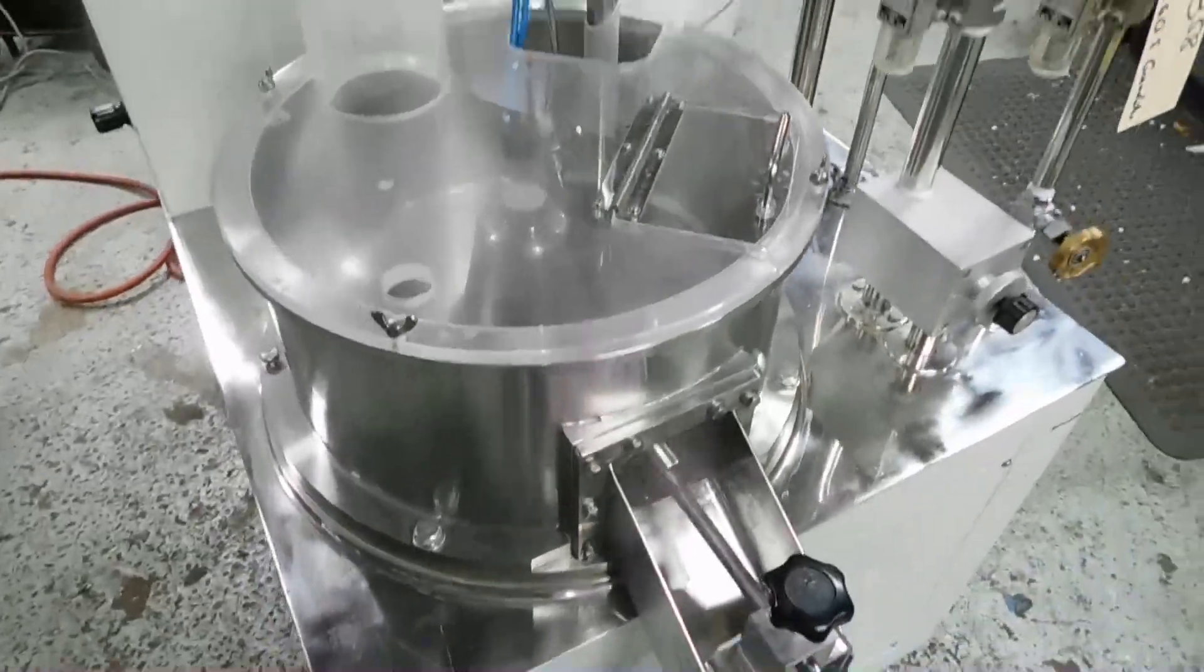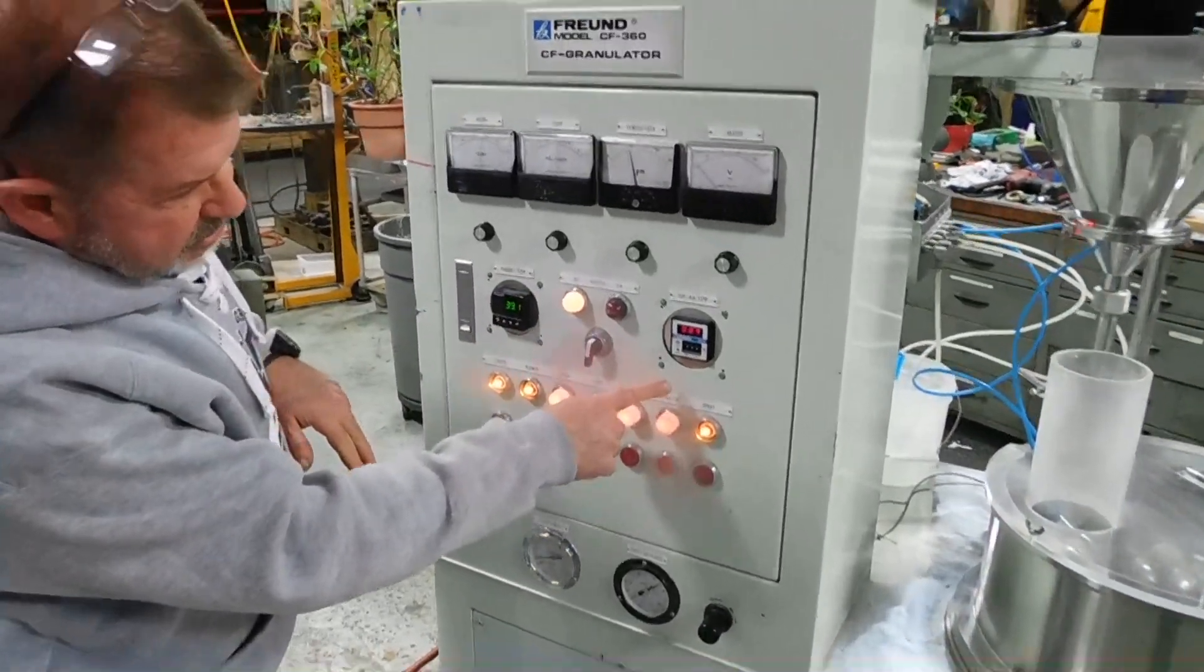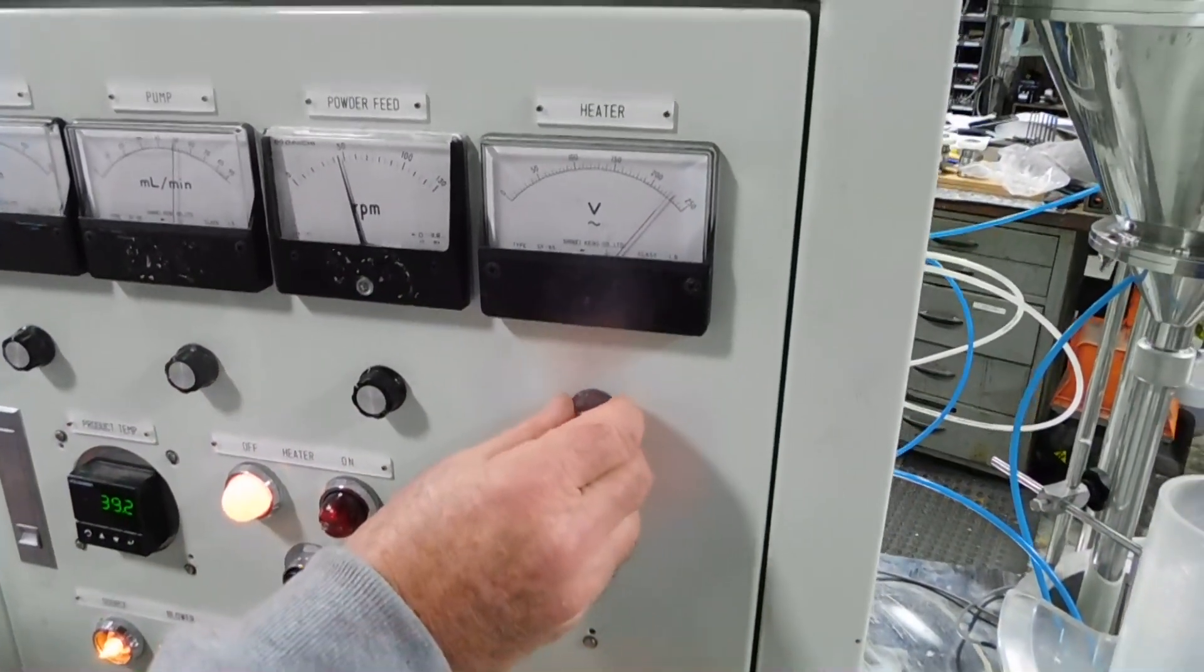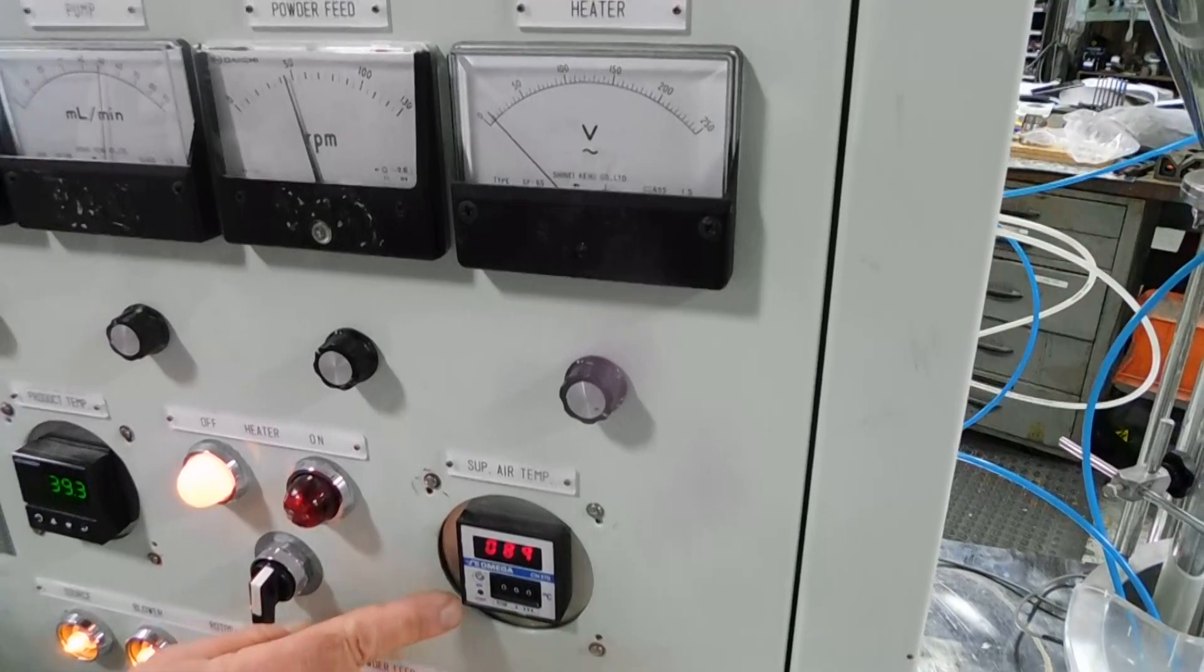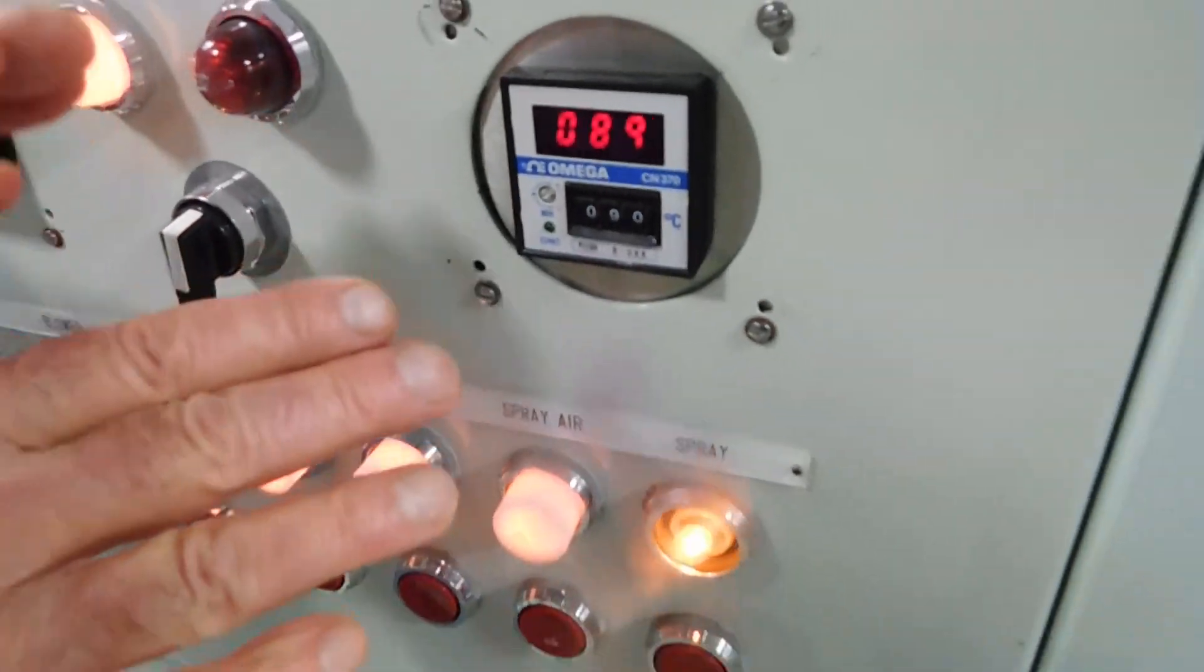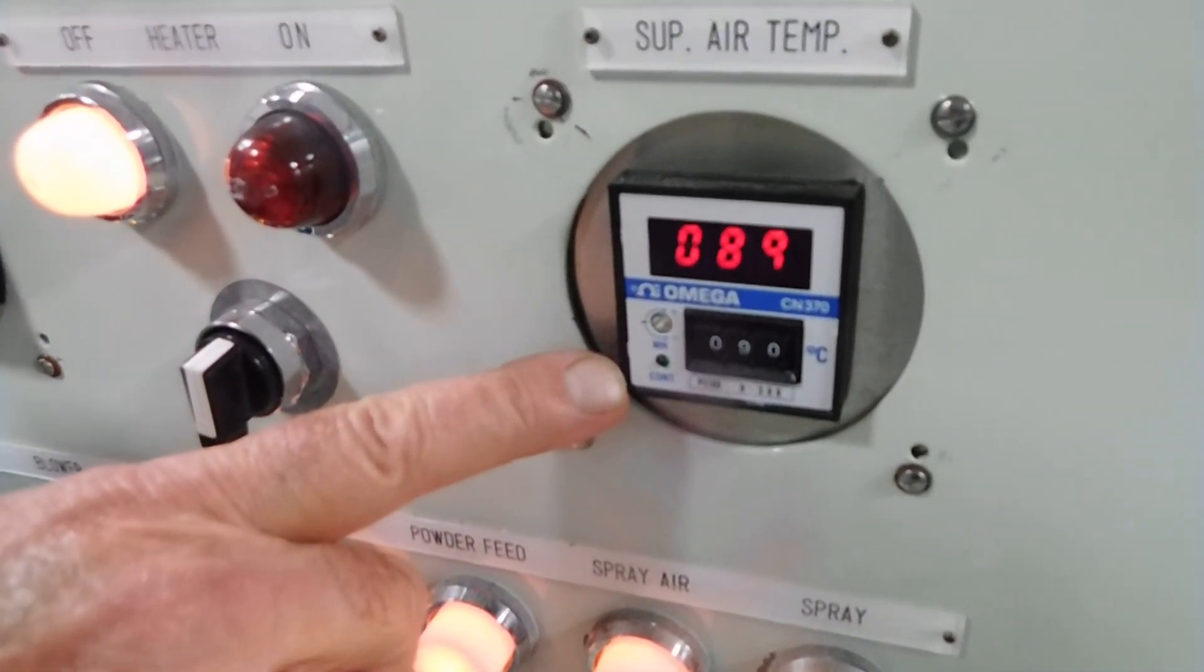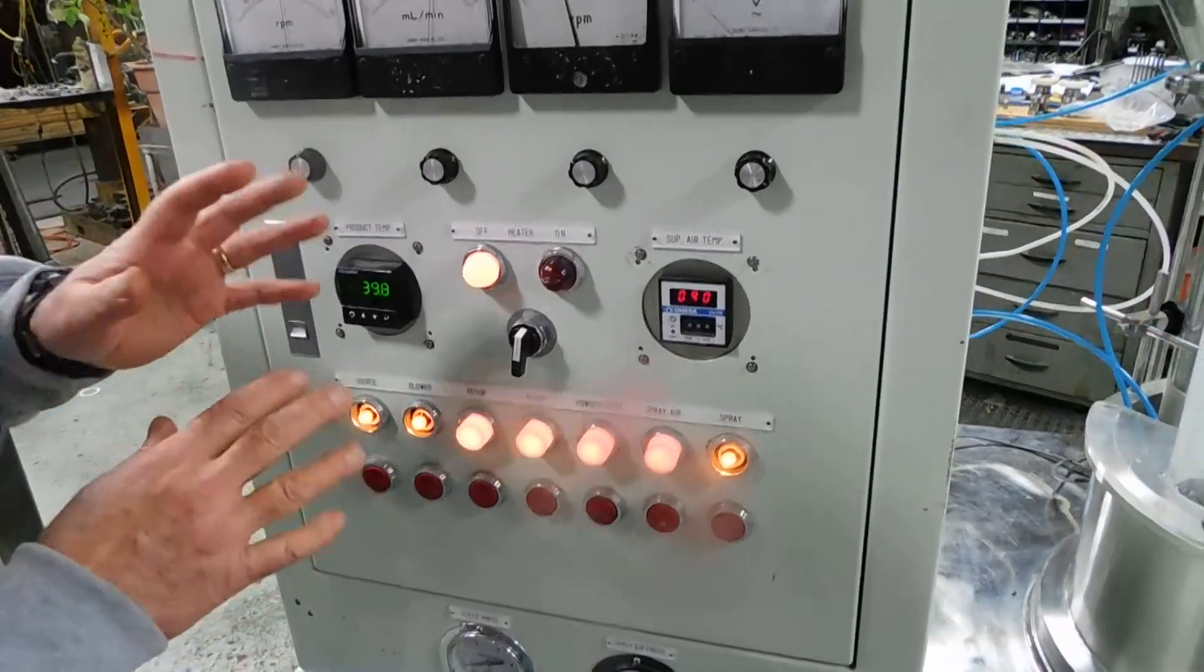I'll show you a little bit what we're doing with the heating controls. This is the master heater control. You see we've got it at a 90 set point, and you see the green light just came on. This is showing the voltage. This is also adjustable. We're not sure how they work together, but once the heat shuts off, you see the needle dive? The heat has come off. The green light has gone off. So it's just trying to balance itself at the 90 degrees Celsius we've set it for. It seems pretty critical, and usually we notice that every 30 seconds or so it'll come on a little bit.